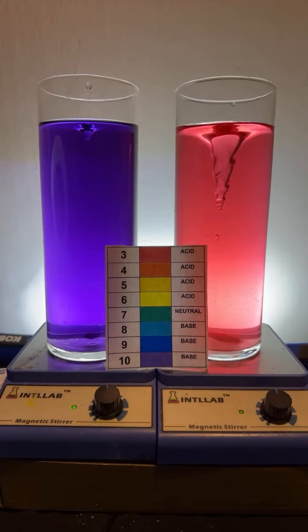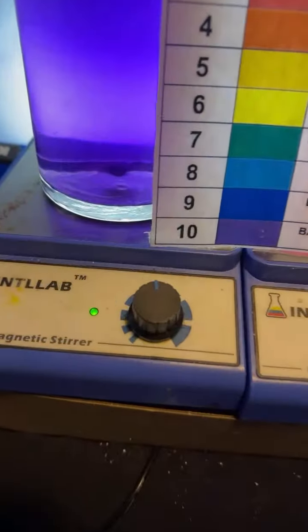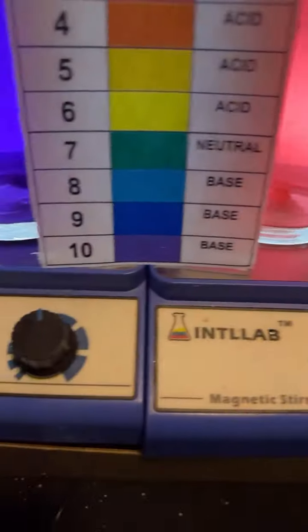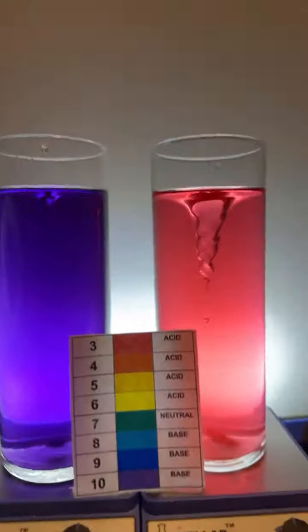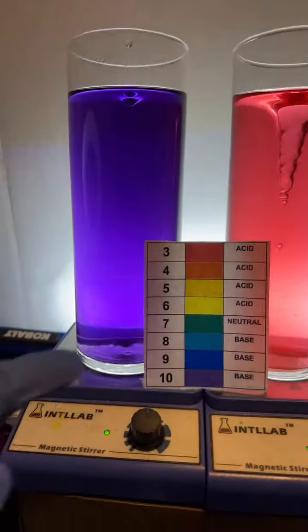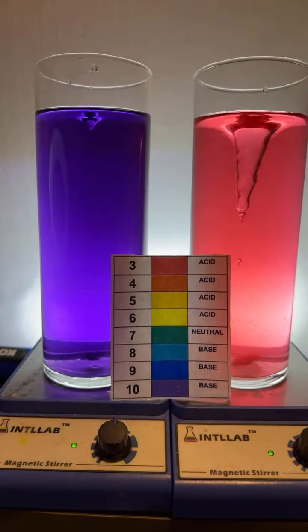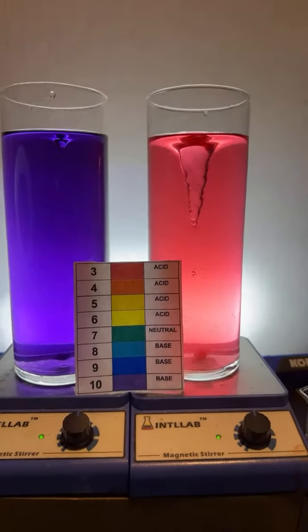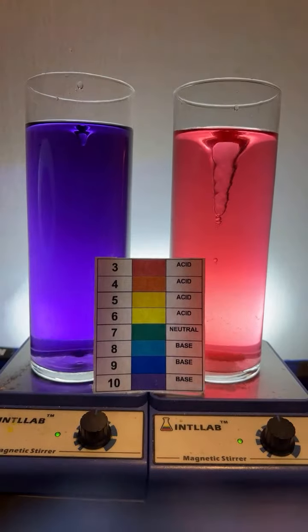Is the left one spinning slower on purpose? The left one actually is spinning. Look, they're spinning at the same speed. I got them both at 1/2, right? Half speed. Oh, maybe that. Okay, let's turn it up just a bit. Now they're both like half speed. The difference is this one is a small stir bar and this one is a very large one, and that's why you're going to see a difference in the sizes of the tornadoes.